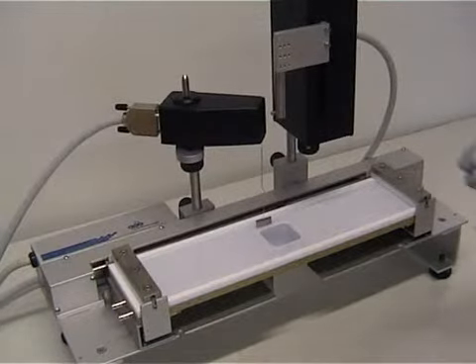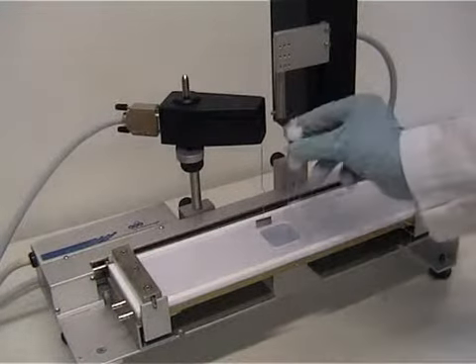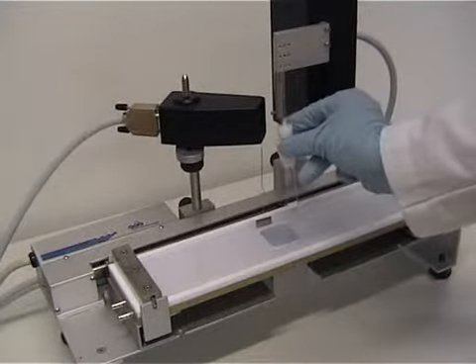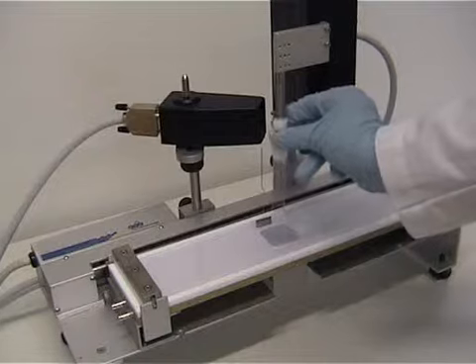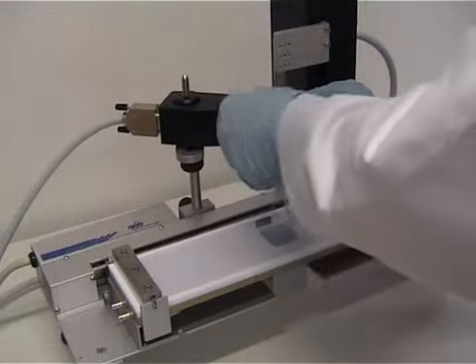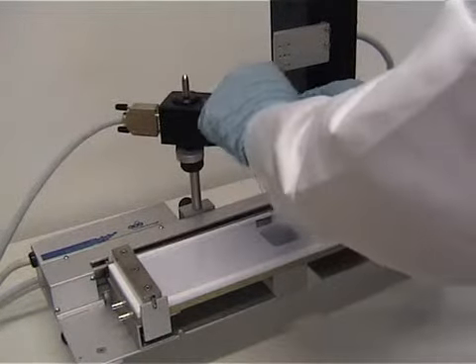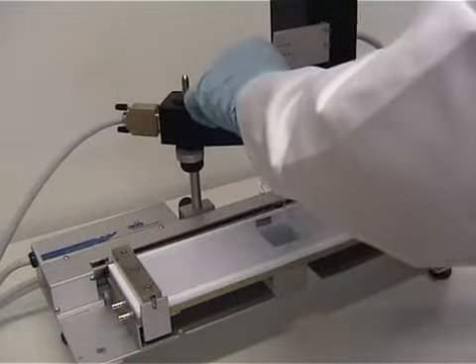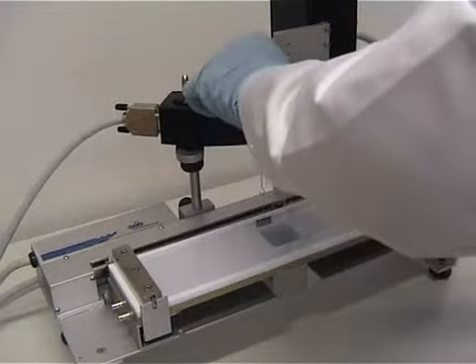Clean the trough and the surface as shown in the isotherm measurement video and check that the surface is clean. Then place the dipping sample on the white holder clip and screw it to the dipping arm.